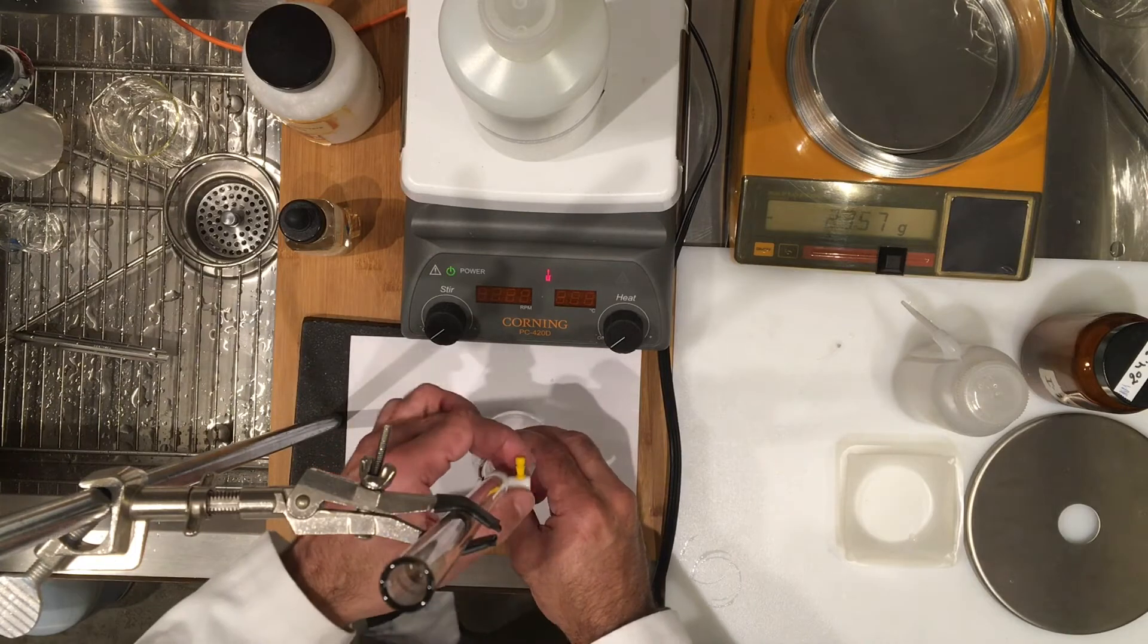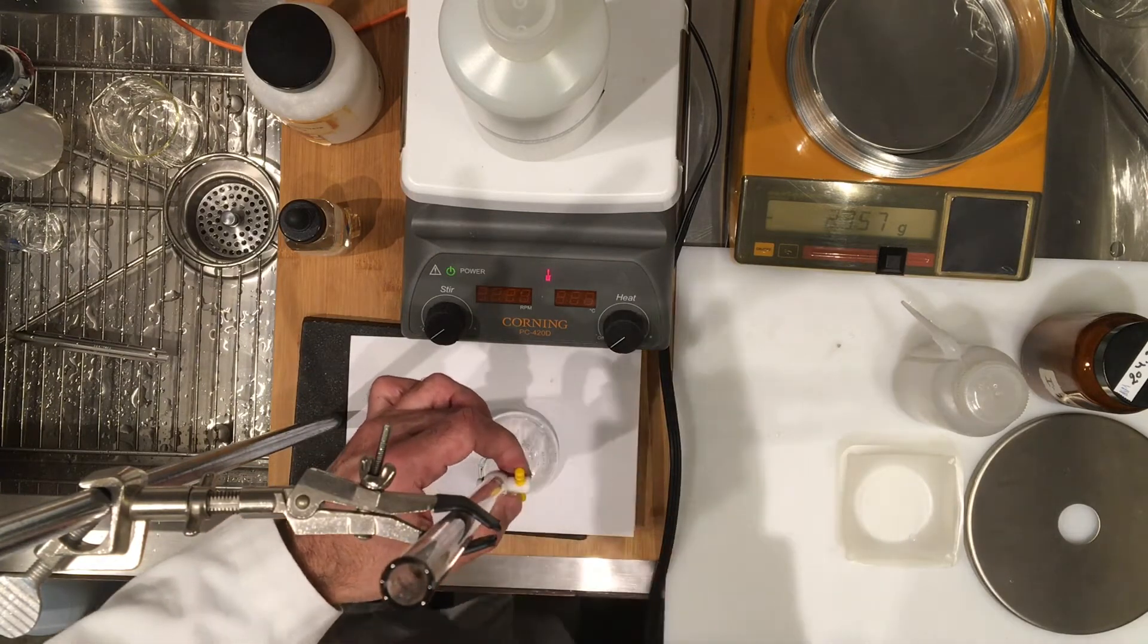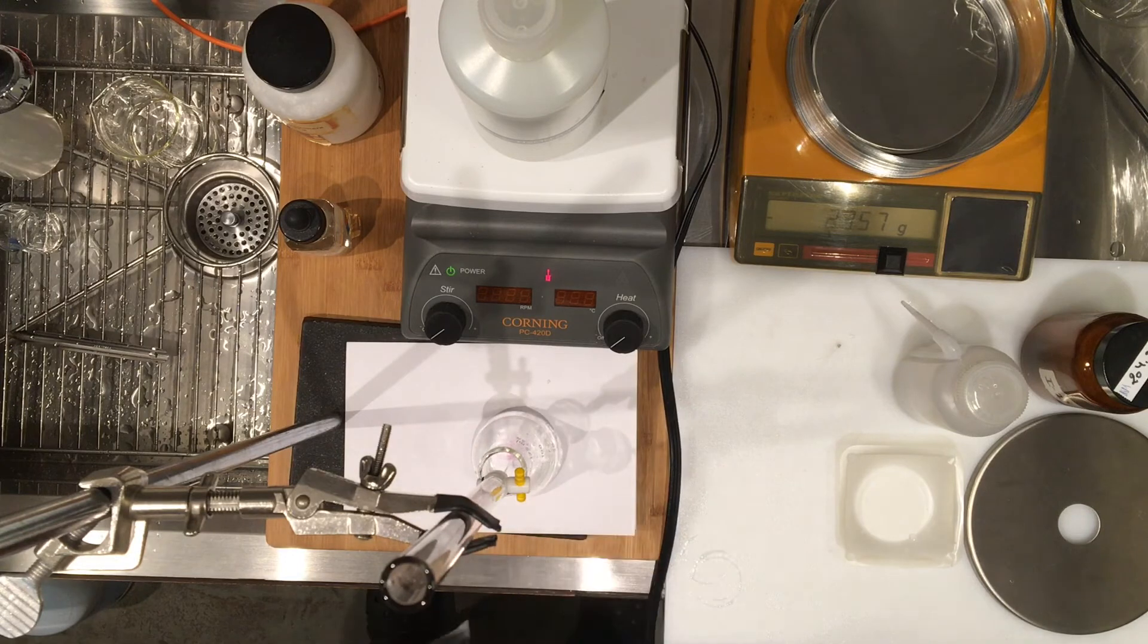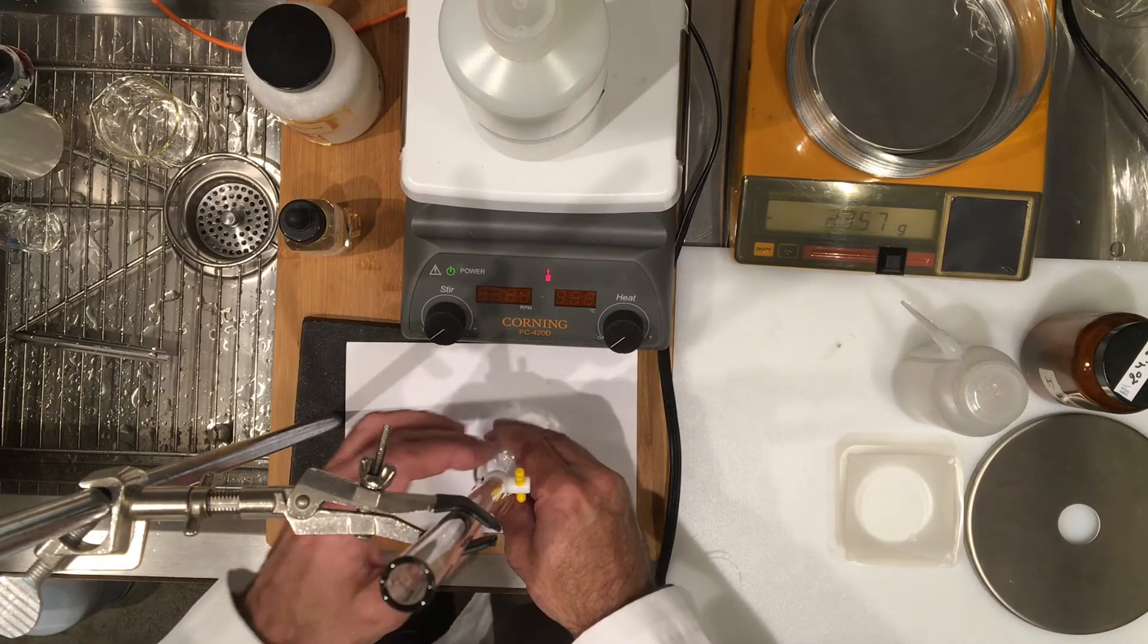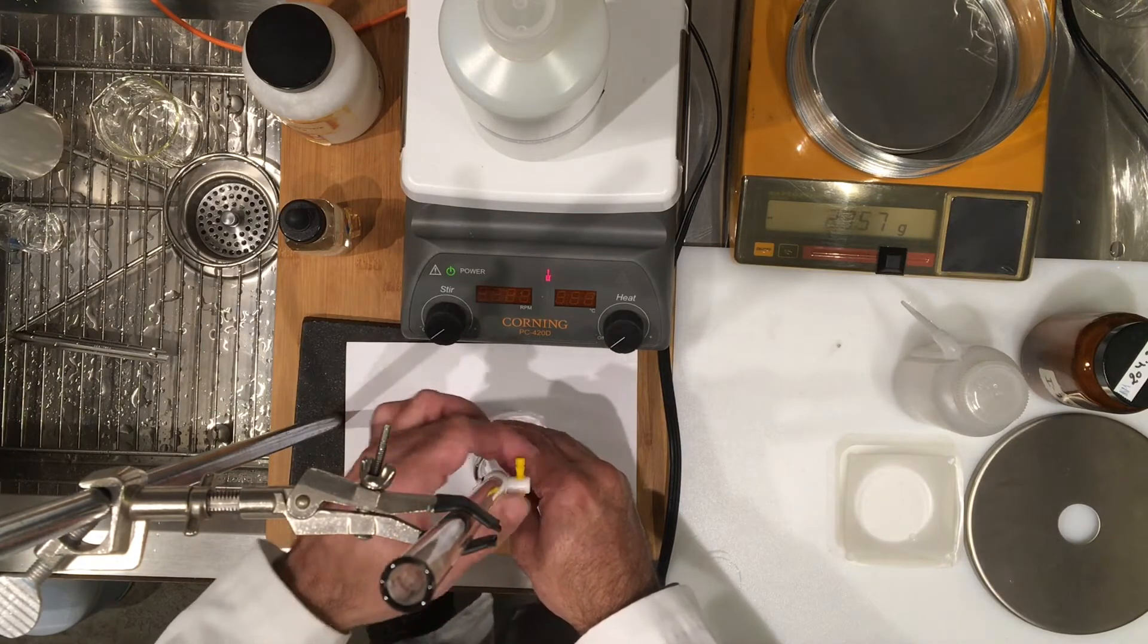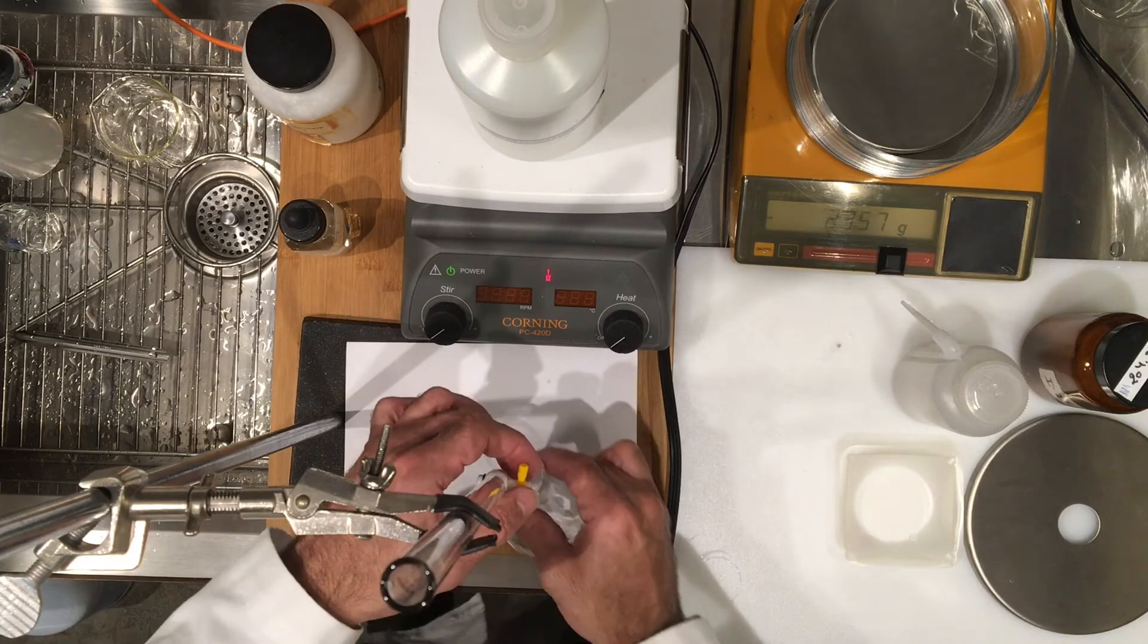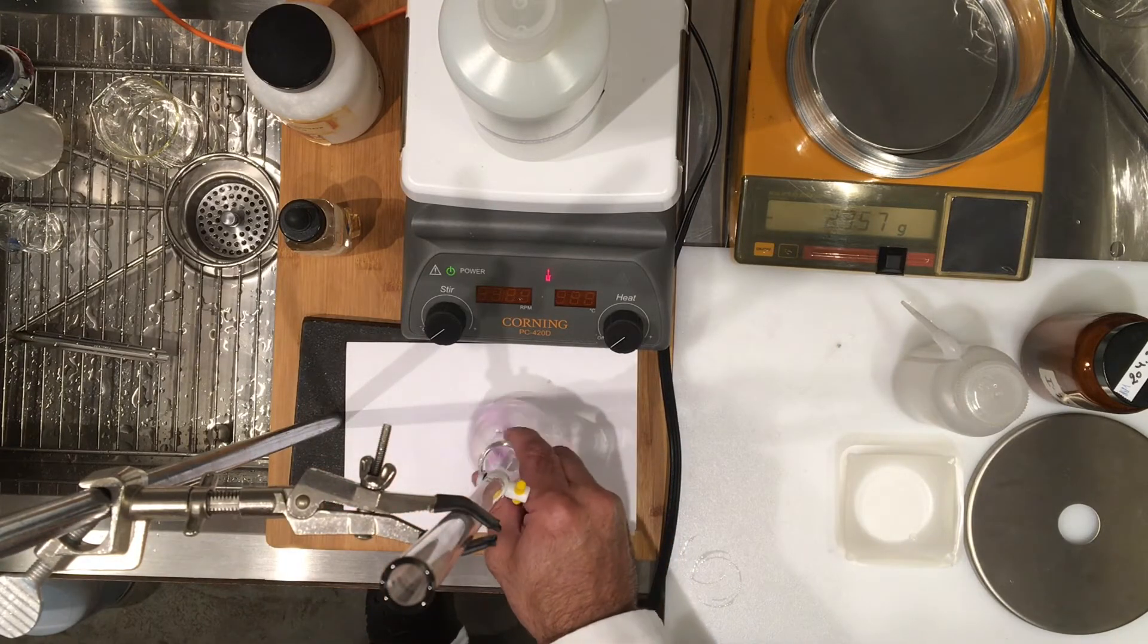So I can go ahead and start and I'm going to add my sodium hydroxide. I had zeroed the burette, so I had started with zero, and you can see that as the solution falls onto the solution, the sodium hydroxide falls onto the contents of the flask, it turns into a pinkish color. I'm trying to show you that but I'll have to wait till we get toward the end. So you can probably see that now.